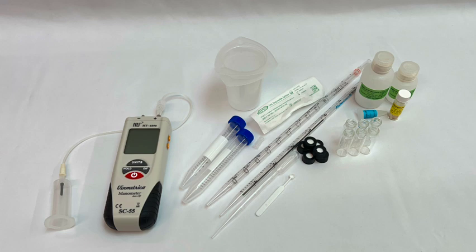The MLF reagents are stable at room temperature for about two weeks, so it is okay if they arrive thawed. When you are ready to begin your testing, simply remove the reagents from the freezer and let them come to room temperature.